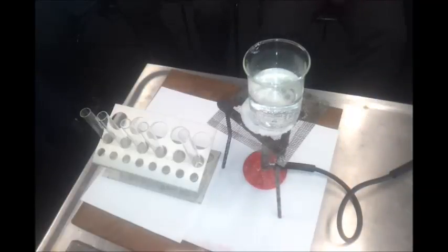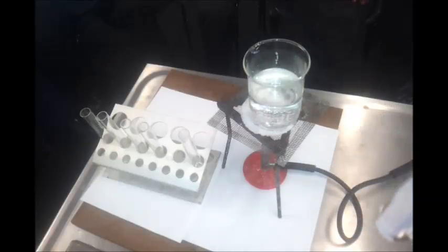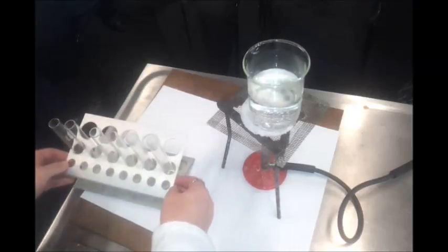Neutral. Okay, what I'm going to do is just add a little bit of water just to see if actually it does react with water, because that was nearly pure ethanol. So even with water, no change. So the solutions they make as well as the pure substance are neutral. Okay, and I'm just going to move those over a little bit so they're not too close to the naked flame.